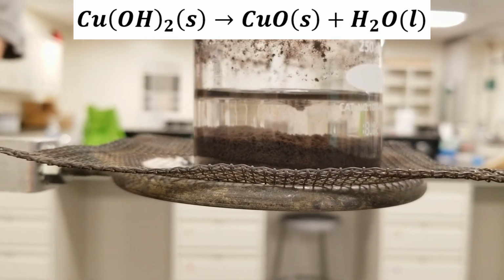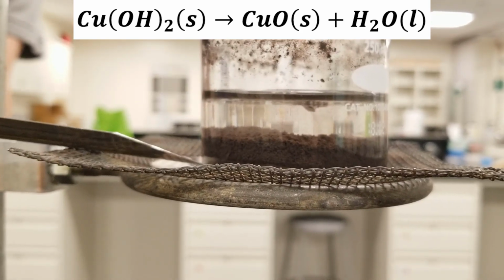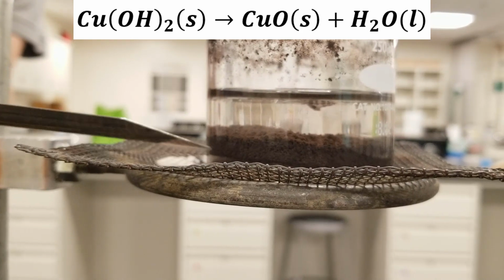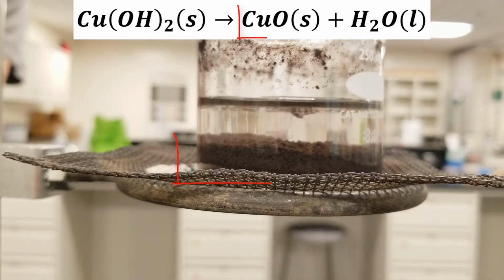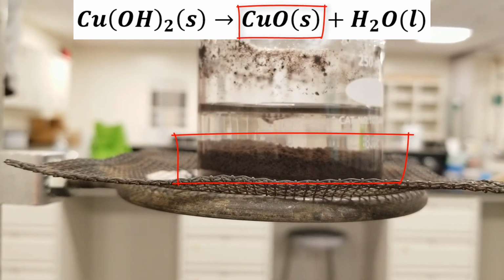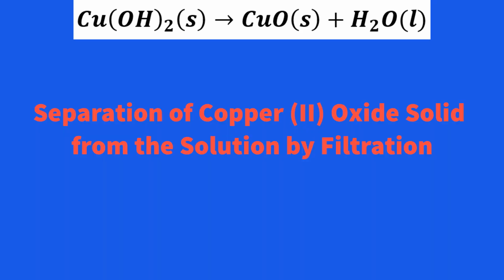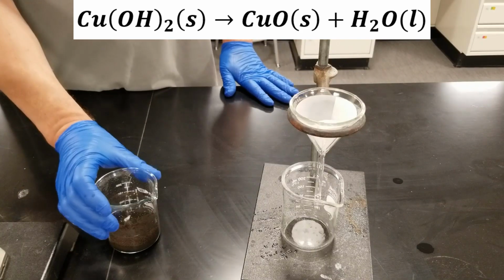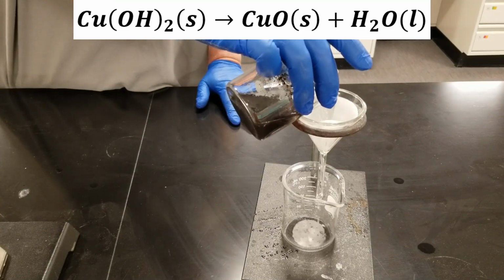Okay, clearly you can see the top layer is pretty clear, and the bottom layer is that black muck. That's the copper oxide, the black mud that you're seeing there. And you can see that the copper oxide is a much more dense precipitate, so it sinks to the bottom. Okay, now I'm going to isolate that copper oxide by filtering it here.